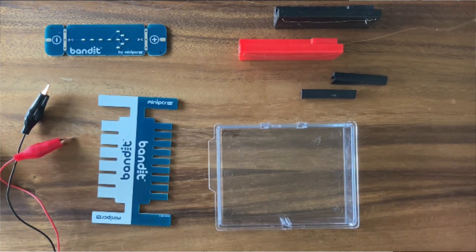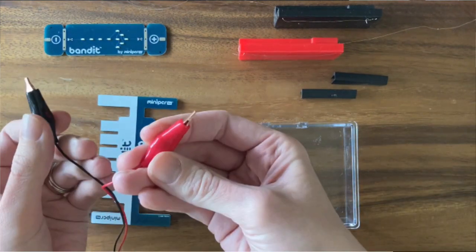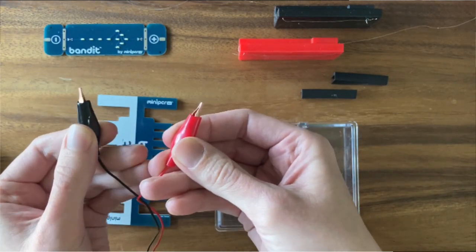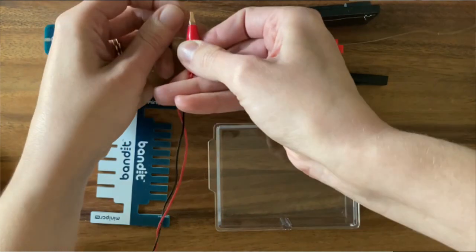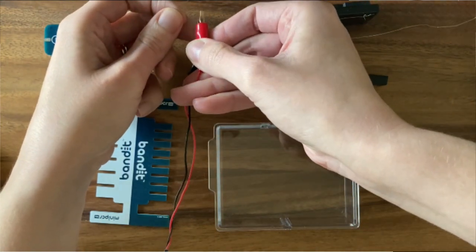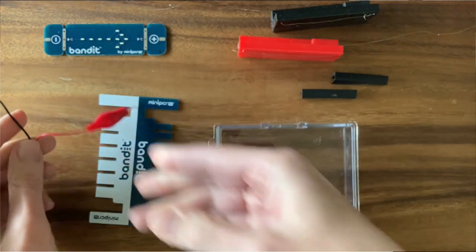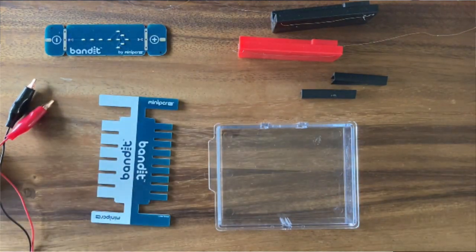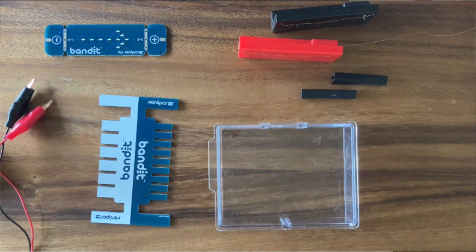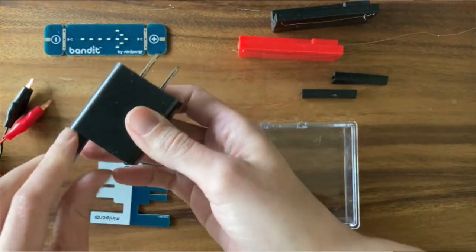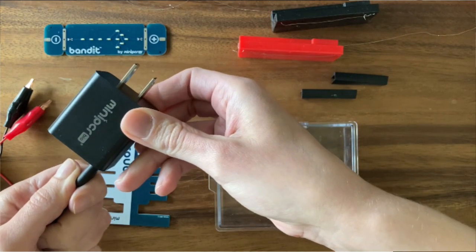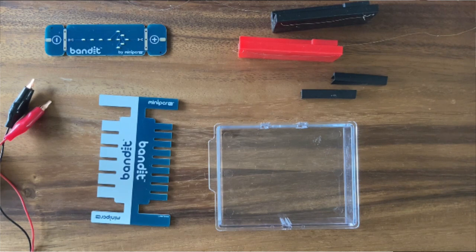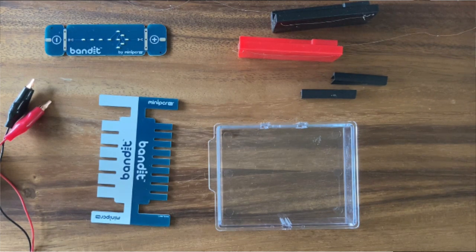We'll need to connect these electrodes to electricity using these alligator clips. These alligator clips are connected to leads. When it's time to power our system, we're going to clip the alligator clips right onto the electrode wire. At the other end of these alligator clips, we plug this cable right into the wall. Here is our power source. In between these sits our circuit controller that houses some safety mechanisms that limit the current coming out of the system. So I'm able to touch those clips safely.